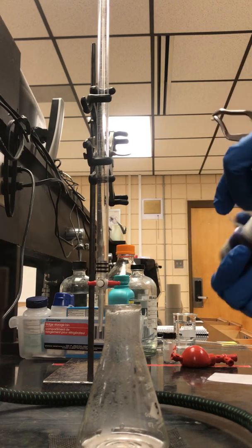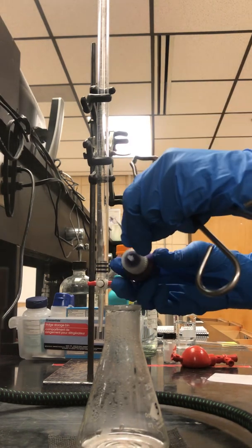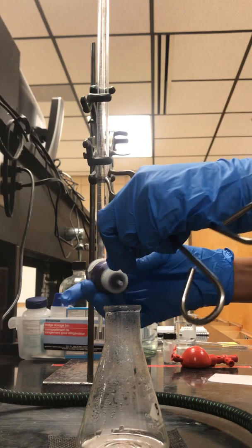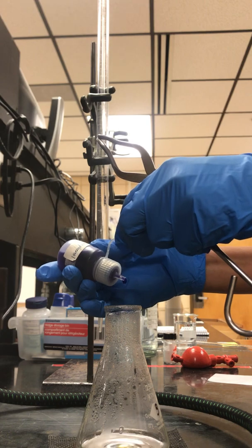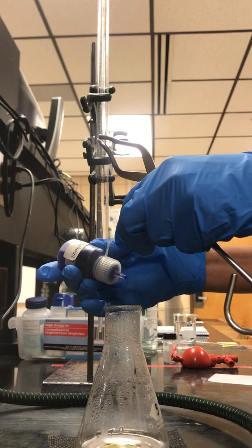You want to add your four to eight drops. Add four, five, six, seven, or eight, however many, as long as it's between four and eight. I'm going to add one, two, three, four drops.